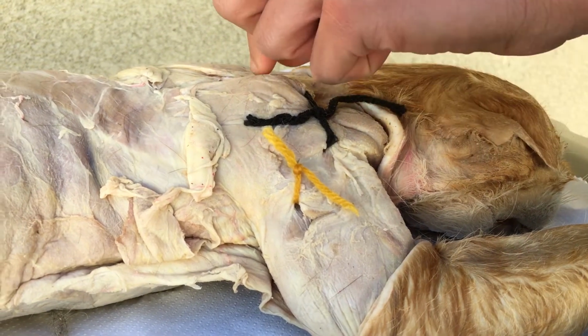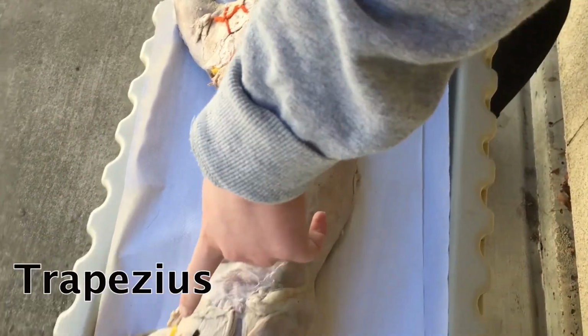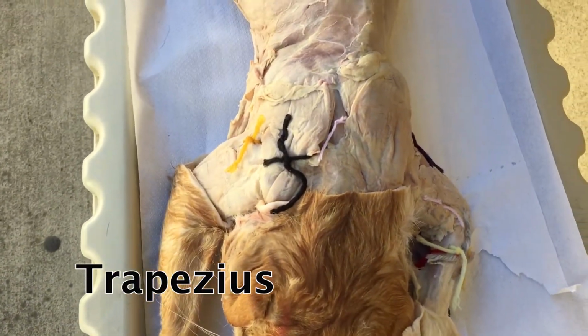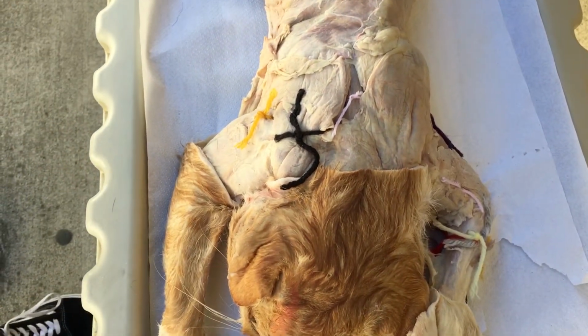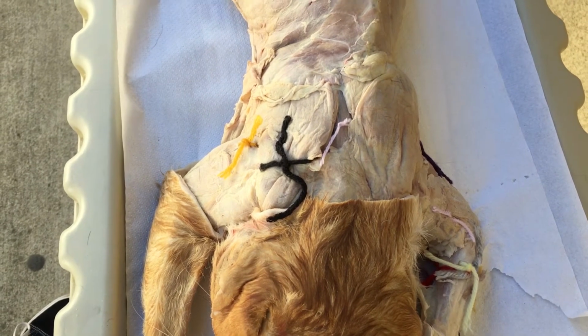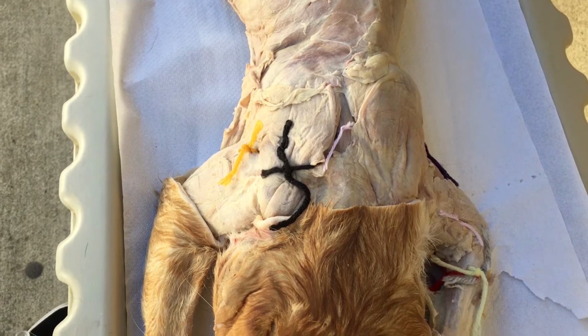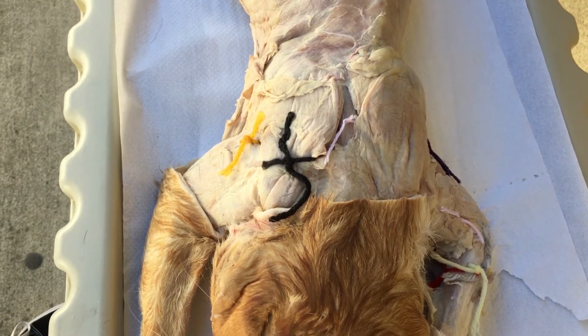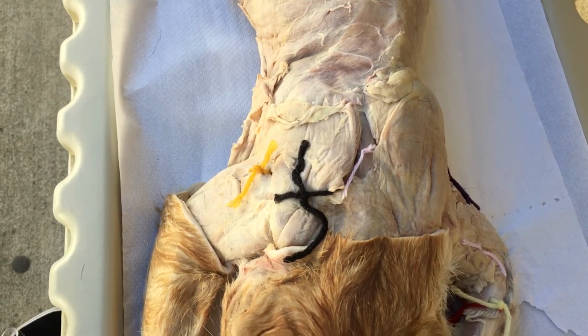This is the rhomboid major. Okay, this is the trapezius. The action of the trapezius is to elevate the shoulders, and its antagonist is the pectoralis major. The origin of the muscle is the base of the skull, and its insertion is the clavicle. The fibers of the trapezius are convergent, which means the fibers cover a broad area but come together. A way to remember the trapezius is that it has a triangle shape, and trapezius and triangle both start with T.